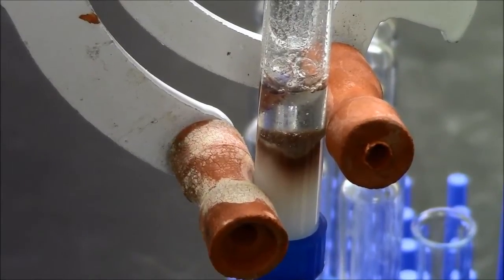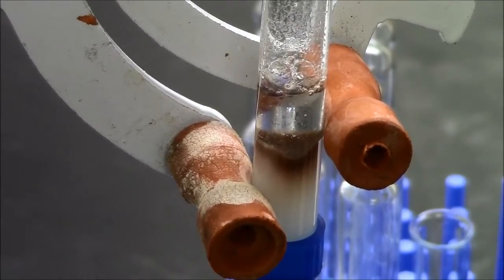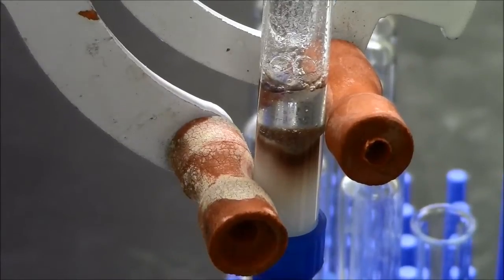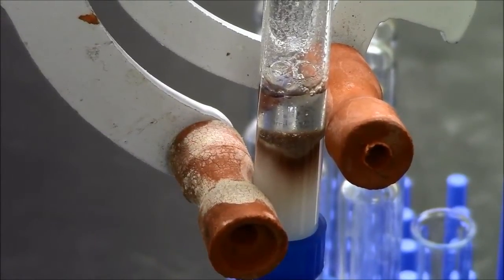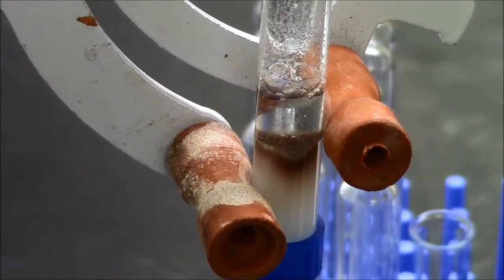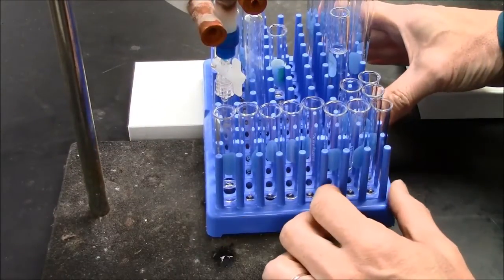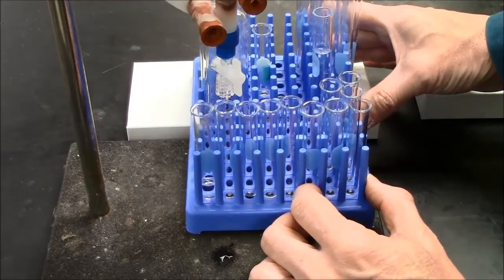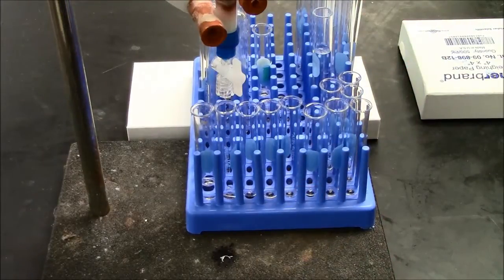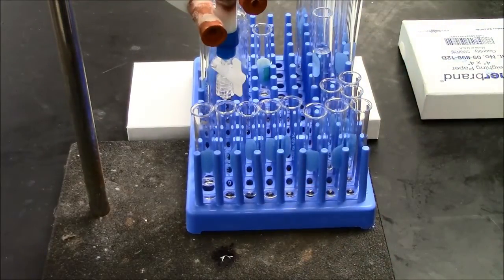I'm looking now to see whether the protein will flow with just this no-salt buffer. I'm hoping that all the protein will remain tightly bound to the column. Here I've got at least a mL in my first fraction. I should go to the next tube. I just do that by moving the test tube rack over, start collecting drips in that second tube.